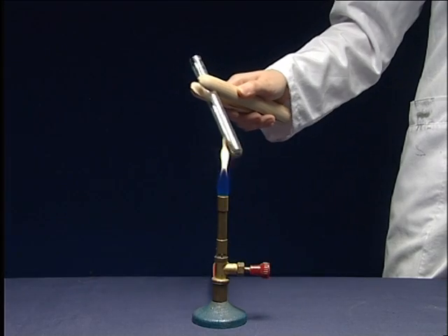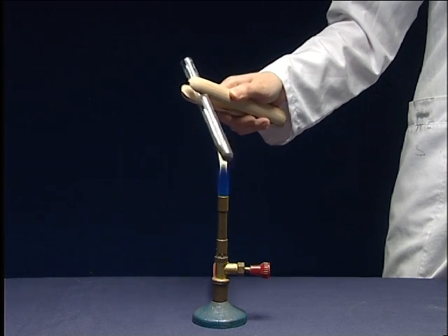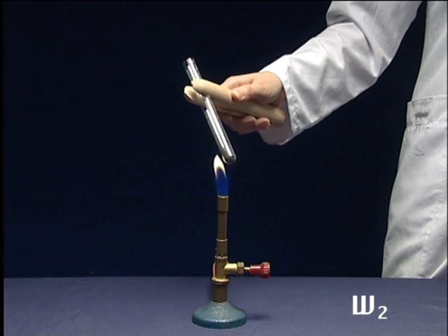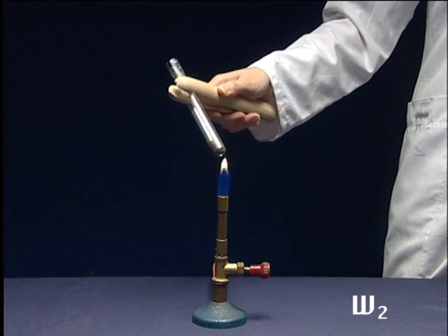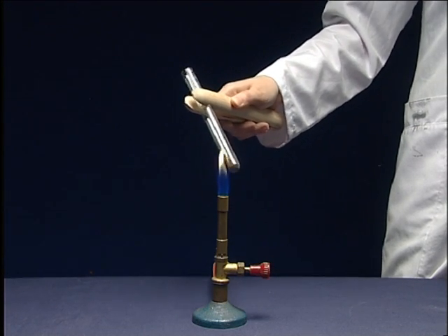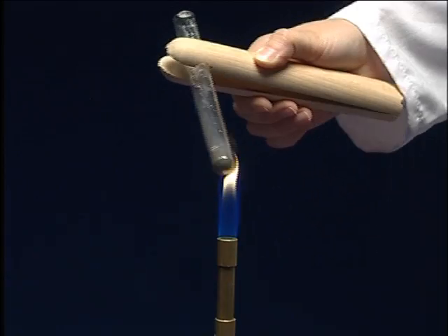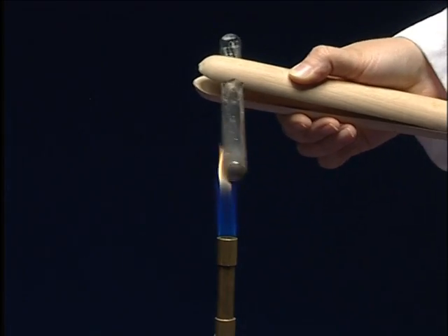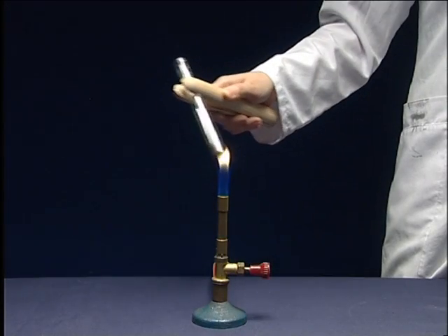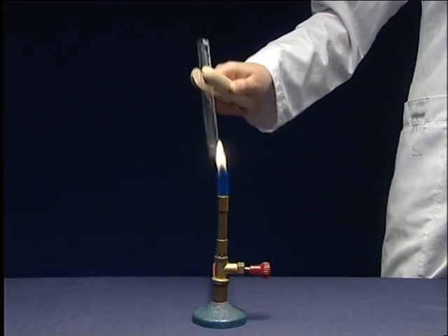Heat the mixture carefully to drive off the oxygen. Calculate the weight of Potassium Chlorate as W2. After the evolution of gas finishes, shut off the burner.